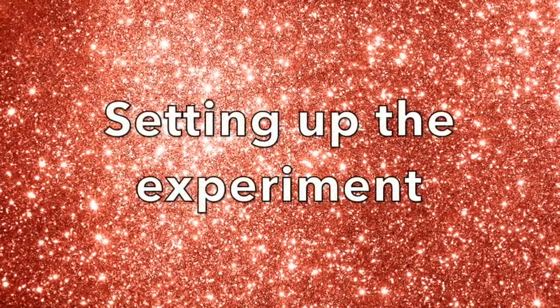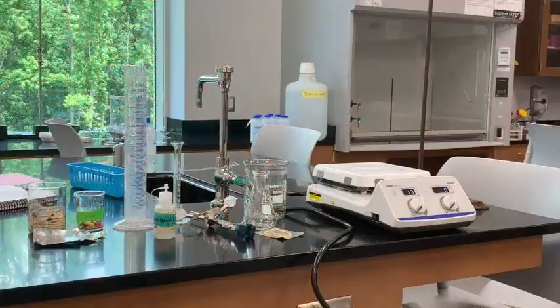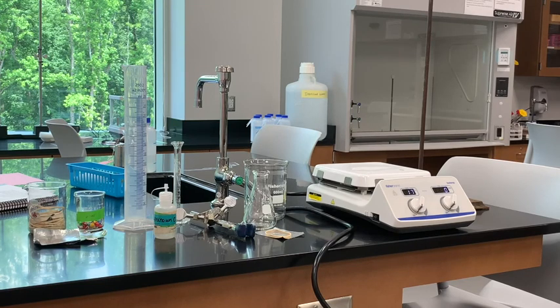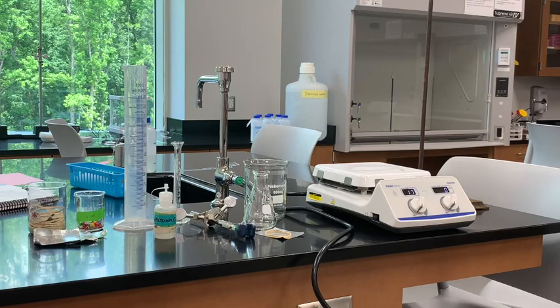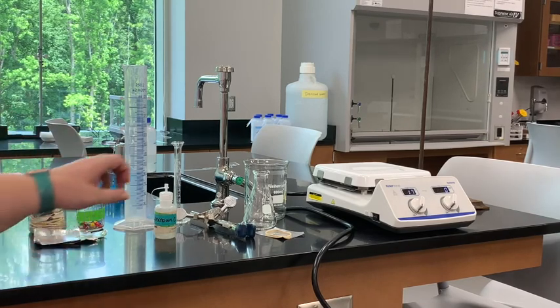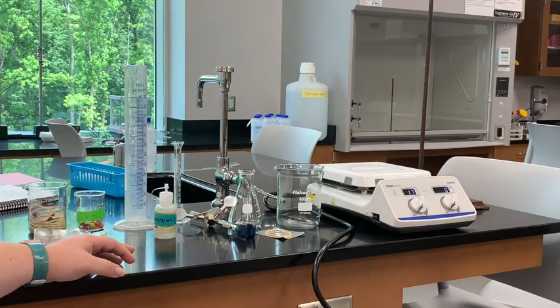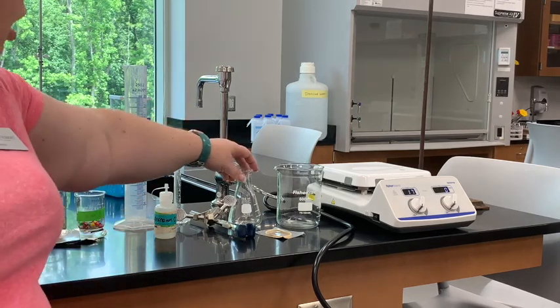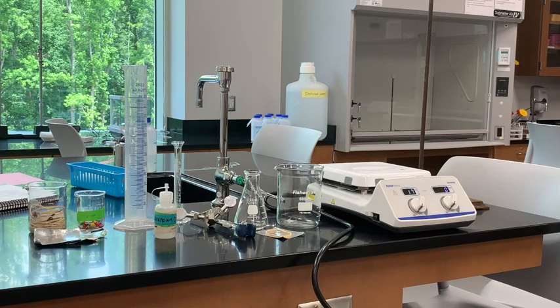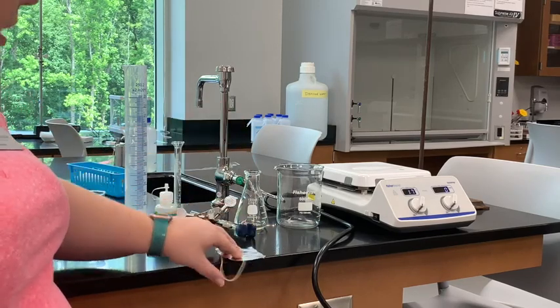Here I have all of the stuff we need to use for this experiment. Starting on the far side of the table, I have a ring stand — we're going to clamp our flask to that and lower it into the boiling water. Then I have the hot plate. We're going to need a boiling water bath in a 600 milliliter beaker. Our flask is where the unknown sample is going to go — it's a 125 milliliter flask. Before we get started, we're going to take the mass of that flask with a rubber band and a piece of aluminum foil on it.